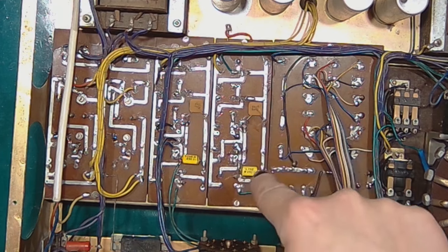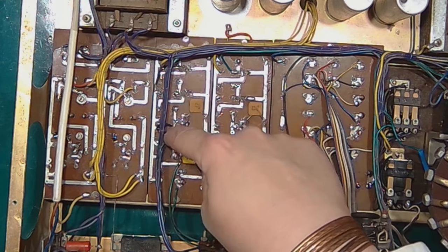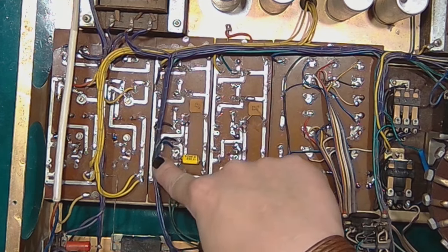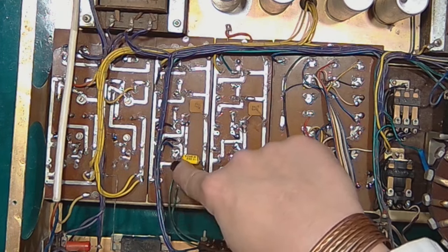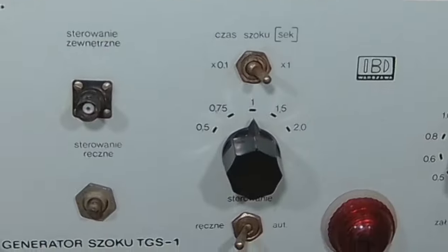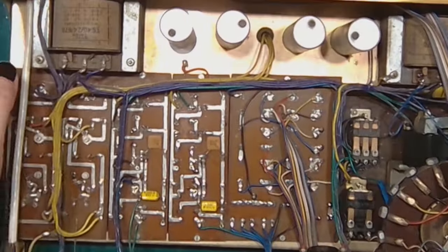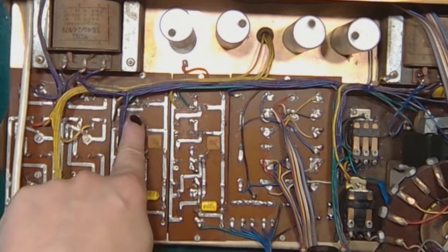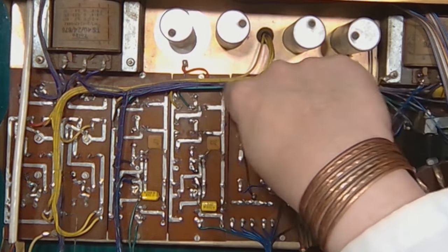This one has a preset time constant, while this one has an adjustable time constant. That's why you see the wires coming out of the board here. And those two green wires go to the automatic or manual control mode switch. Both of those boards have their outputs wired between the plus 13 volt line and the collector of an output transistor, and they go to the relays here.